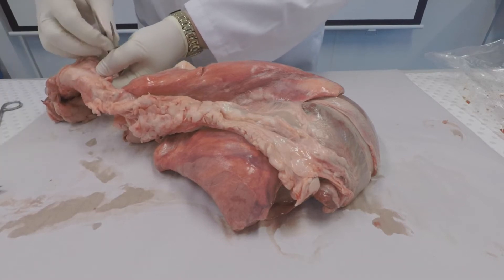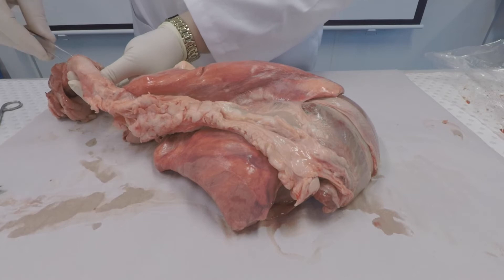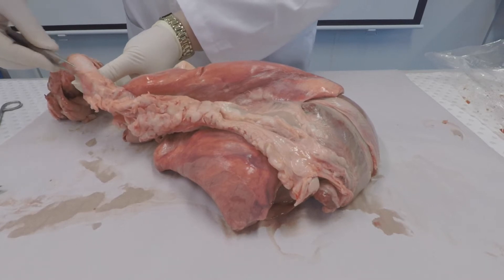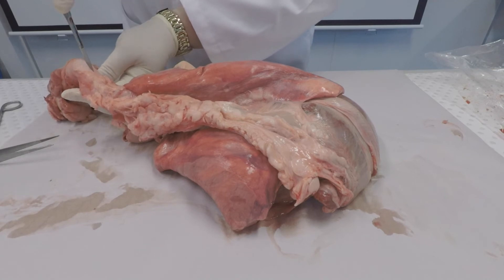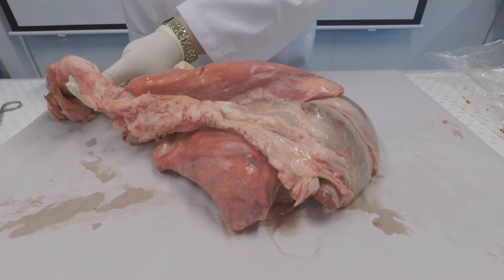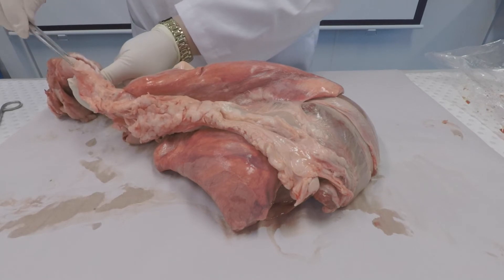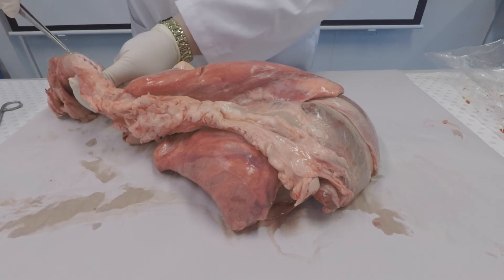You'll notice that it's a very rigid structure, and that's because it has cartilage rings supporting it to keep it open. I'm just going to dissect that open just to show you the cartilage rings. And you can see the cartilage rings there.